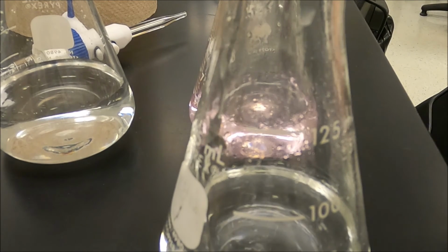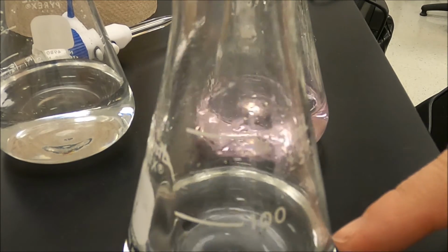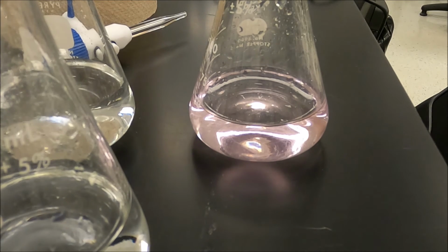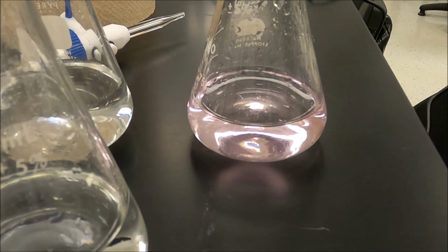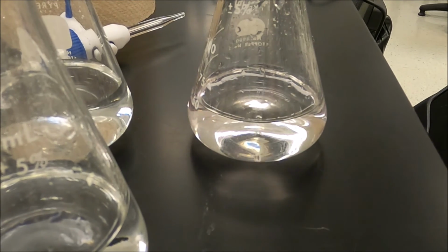Now, we are playing with a weak acid here, not a strong acid. When we go back to what's called the half titrated point, the pH at half titrated equals the pKa. And the Ka then is 10 to the minus pKa. So we're going to have a very convenient way, a second method to calculate the Ka for our acid. All right, in we go.